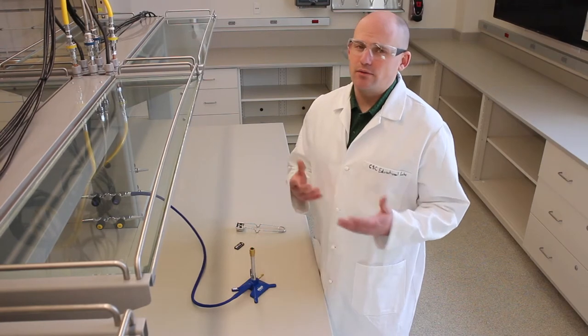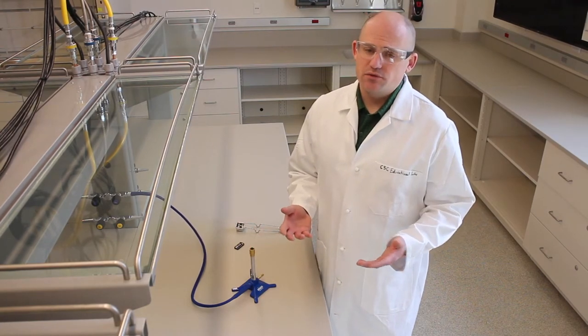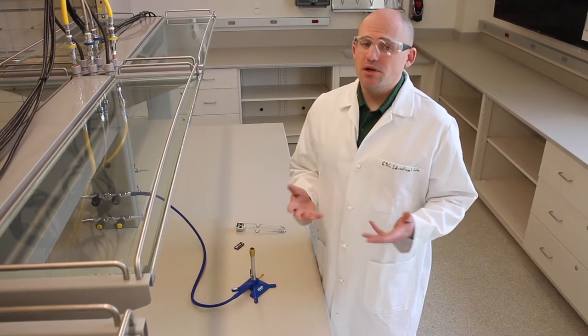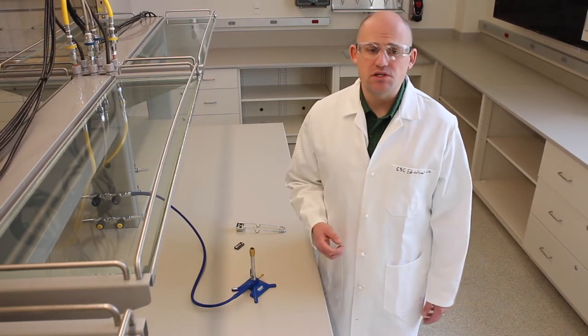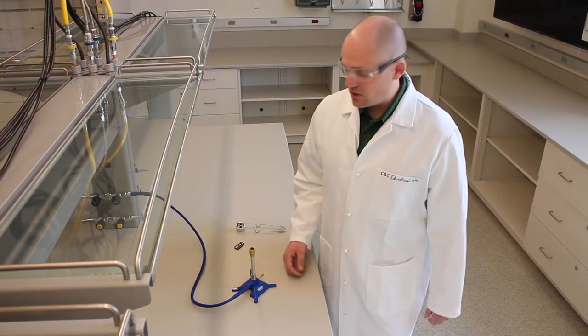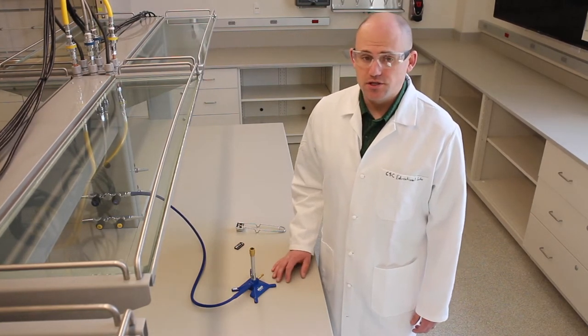Now Bunsen burners are used in a variety of laboratory courses, from sterilization of glassware to thermal decomposition of material. Bunsen burners have many practical uses, and knowing how to use one properly is both a useful laboratory skill as well as a safety consideration.